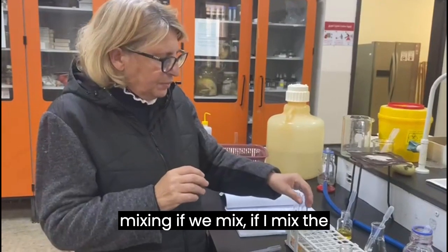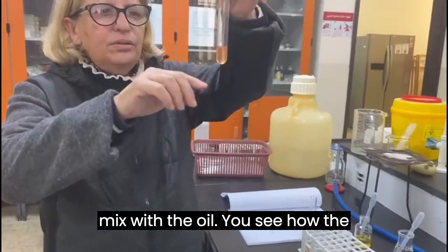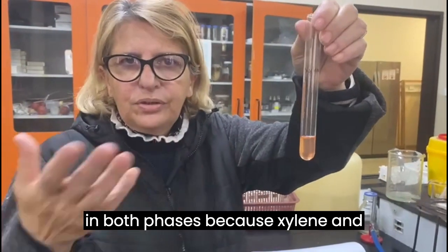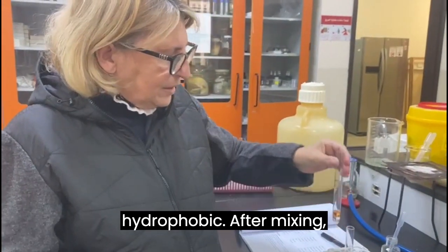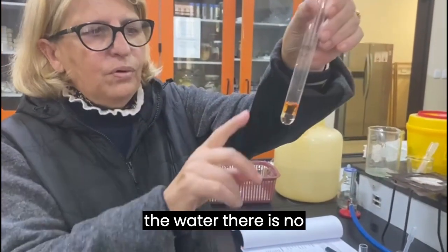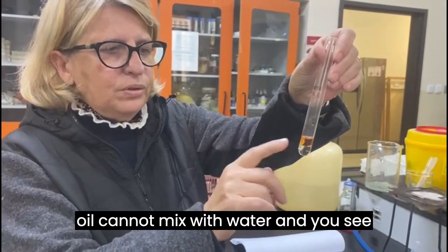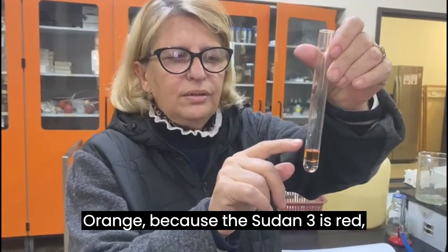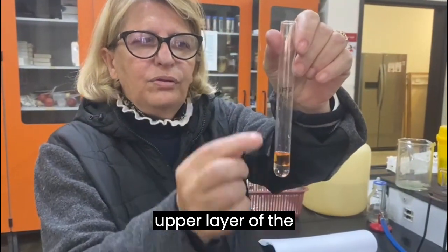If I mix the xylene tube, which can mix with the oil, you see how the Sudan is equally distributed in both phases because xylene and oil can mix together because they're both hydrophobic. After mixing the water, there is no mixing because the oil cannot mix with water, and you see how the changing color of the corn oil, orange because the Sudan 3 is red, stays in the upper layer of the water test.